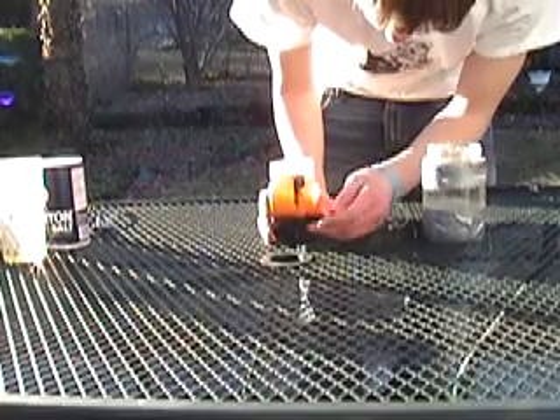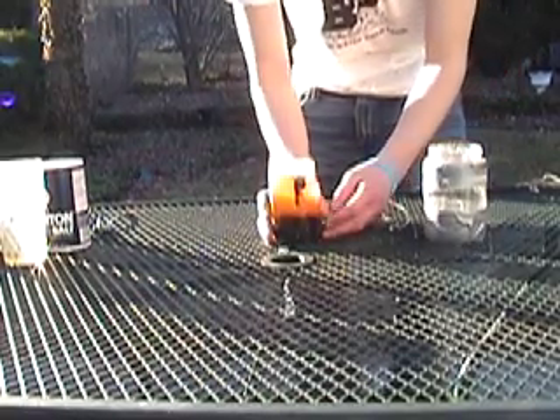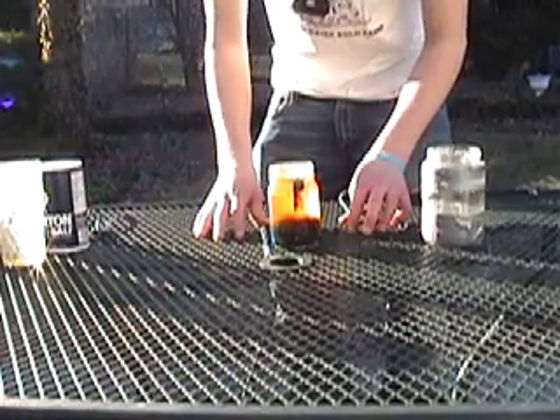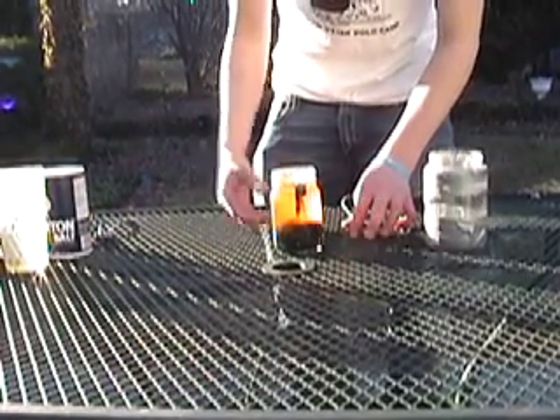You can see it coming down — it's all rust, all rust down here. A lot more effective than your typical 9-volt battery. It also won't run out of power as quickly, like a 9-volt.